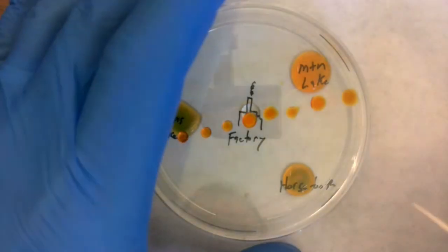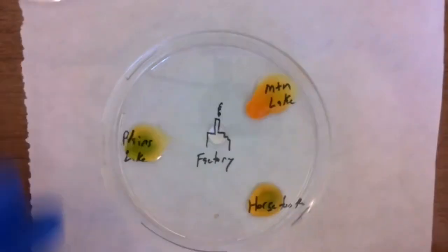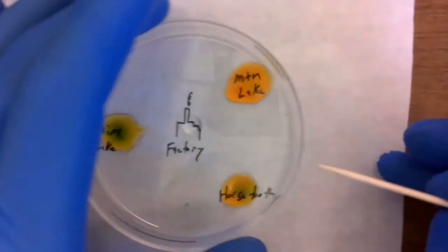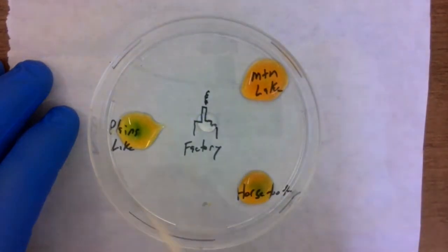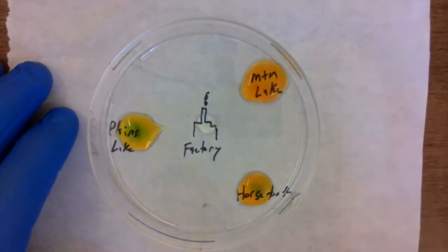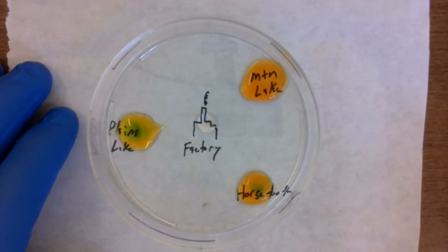Okay. Well, I'm going to go ahead and take the lid off of here. We can see those clouds have changed all throughout, and we'll set that aside. And if we just re-look at our lakes here, again, mountain lake completely acidified. Horsetooth, pretty much all the way, right? There's just a tiny bit of green in there. And then the Eastern Plains Lake is not quite as orange. It's kind of a yellowish color, so it's not quite as acidic. And we still see a good chunk of green where it hasn't changed that lake all the way through.